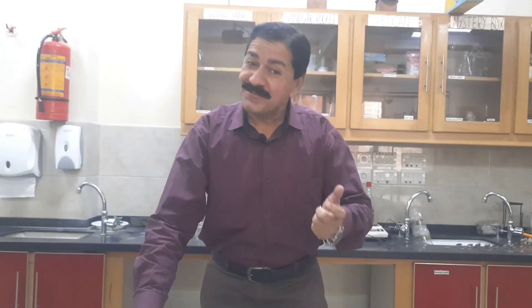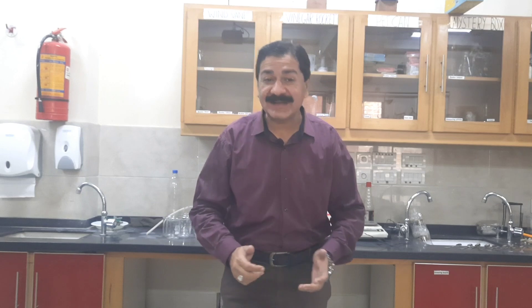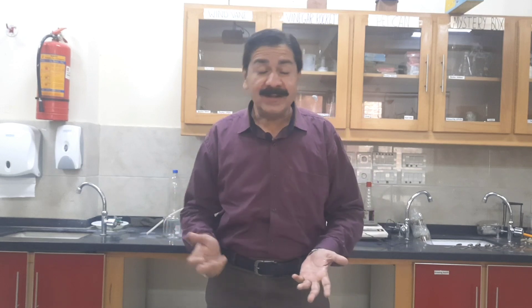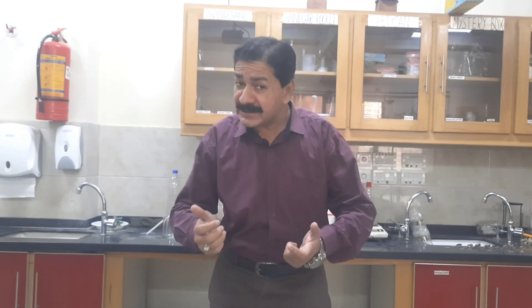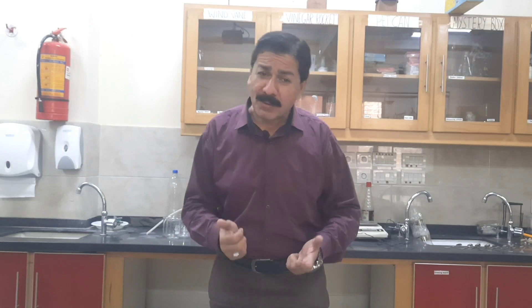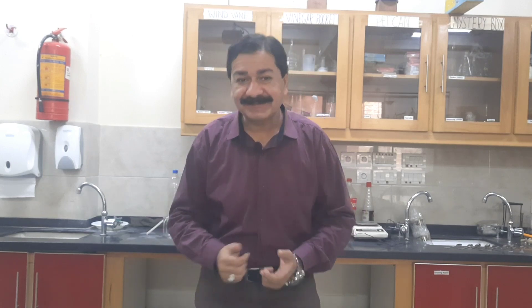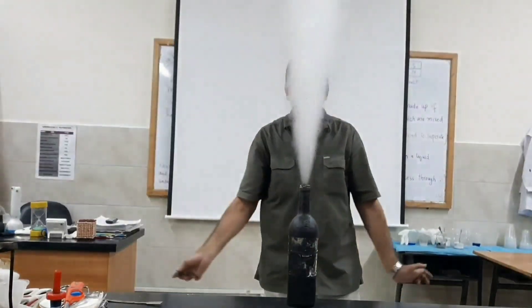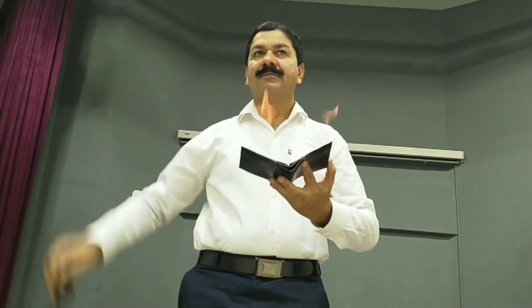It's science, not magic! Welcome to the Ask the Humor Science channel. Today we are doing two amazing science activities. We are going to learn oxidation and reduction reactions and the rate of chemical reactions. Our first activity is Blue Bottle Magic, or Blue Ink Magic. Welcome to Ask the Humor Science channel, where science becomes super fun and learning at the same time.